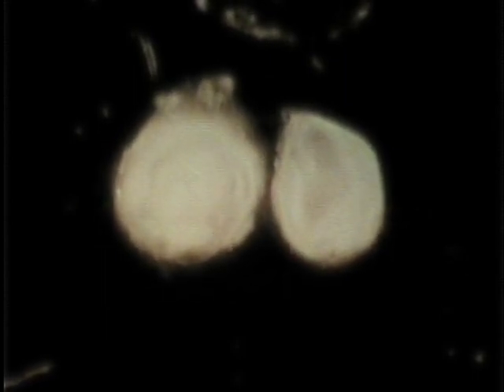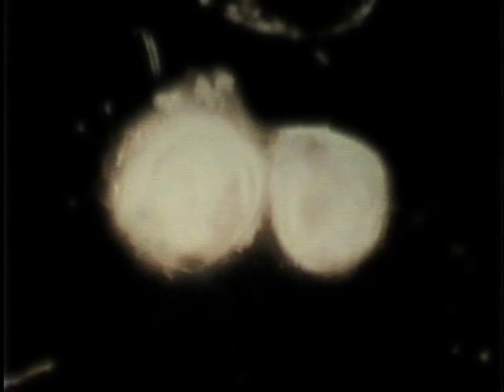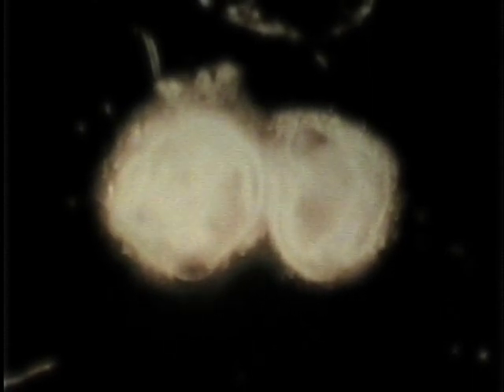The dorsal portion of the otocyst on the left is differentiating into 3 semicircular canals and their ampullae. This will come about without the statoacoustic ganglion. The ventral half of the otocyst is differentiating into the cochlea. The cochlear duct can be seen forming in the upper portion of the specimen and coiling towards the left. The right-hand specimen contains the statoacoustic ganglion. Other experiments have shown that the utricle and saccule arise from the middle of the otocyst.